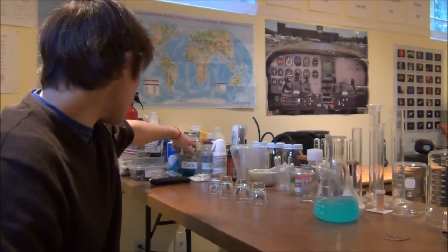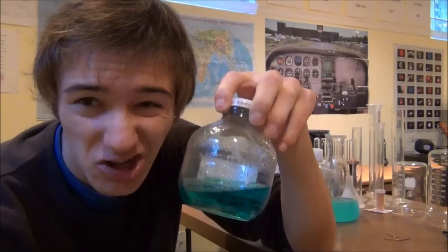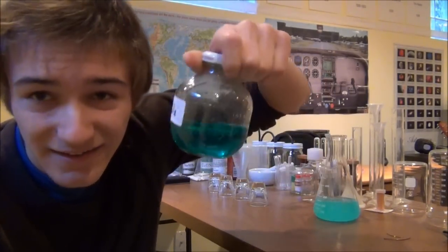Really one of my favorite substances to work with in general is copper because everything is this beautiful green blue. I'll show you some of them. This here is copper chloride, it's more of a greenish color, but isn't that nice?